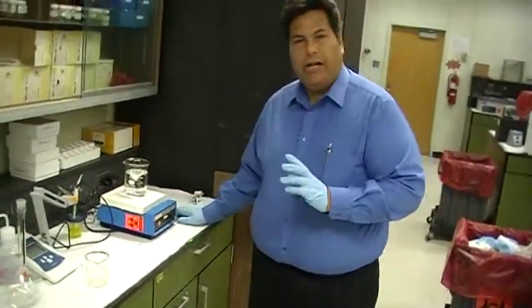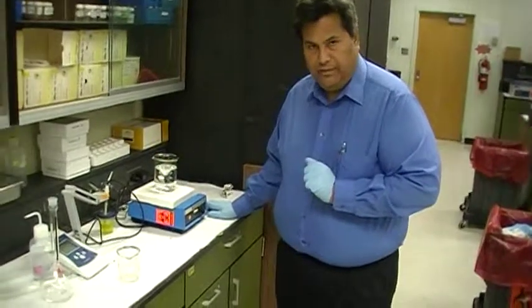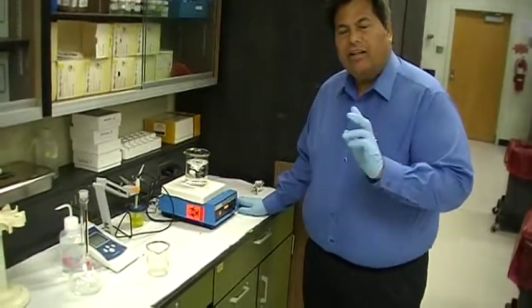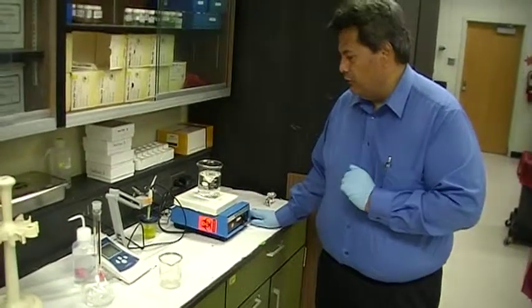Okay, I'm going to show you how to use the pH meter with respect to making solutions and pH-ing the solution, adjusting the pH of the solutions.